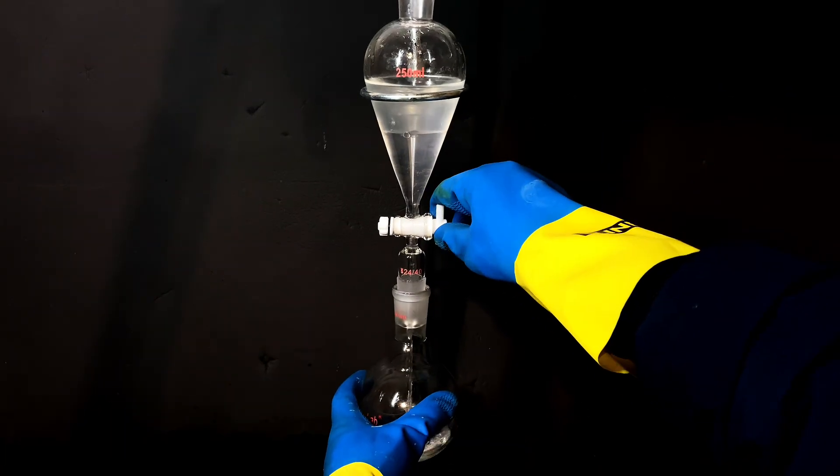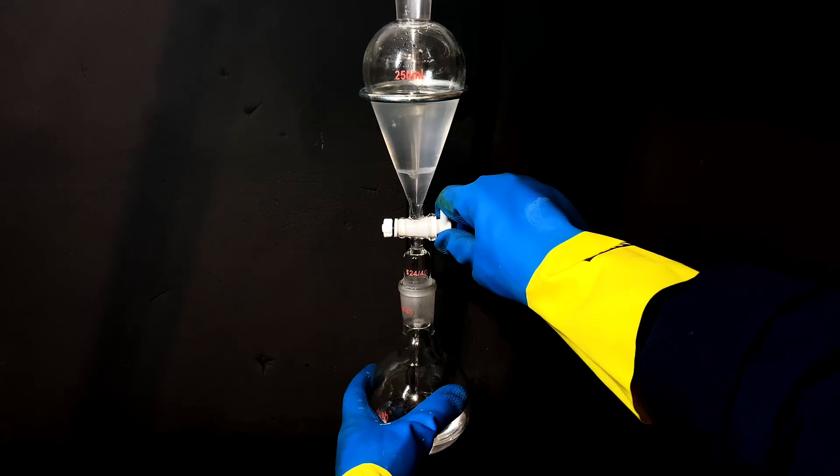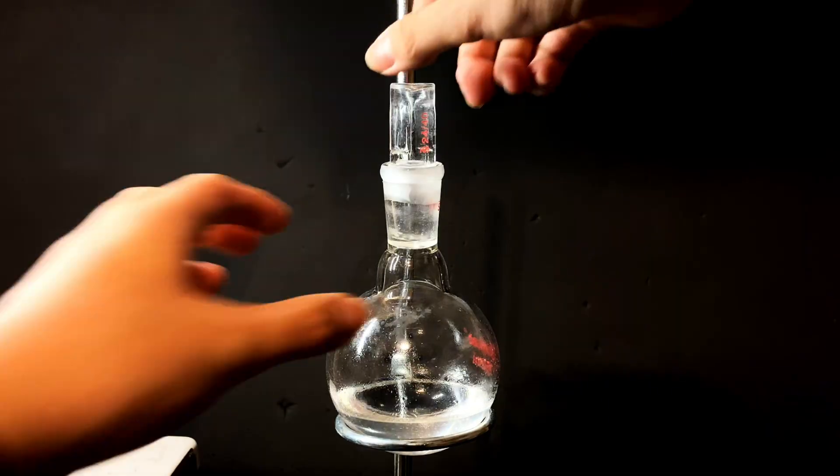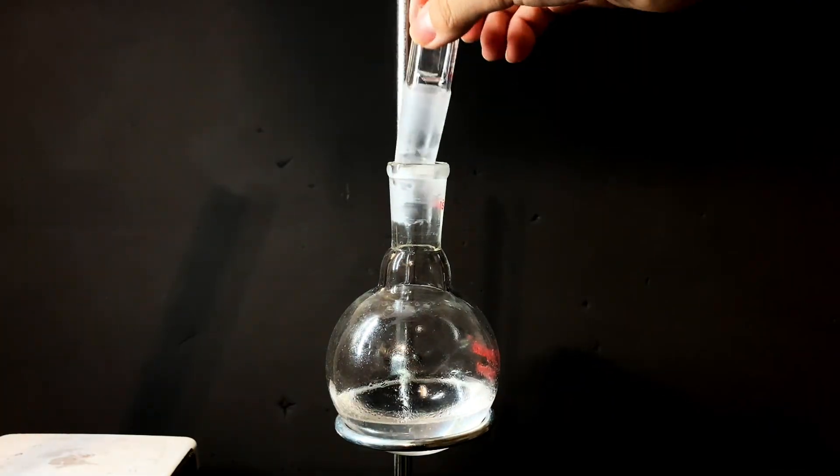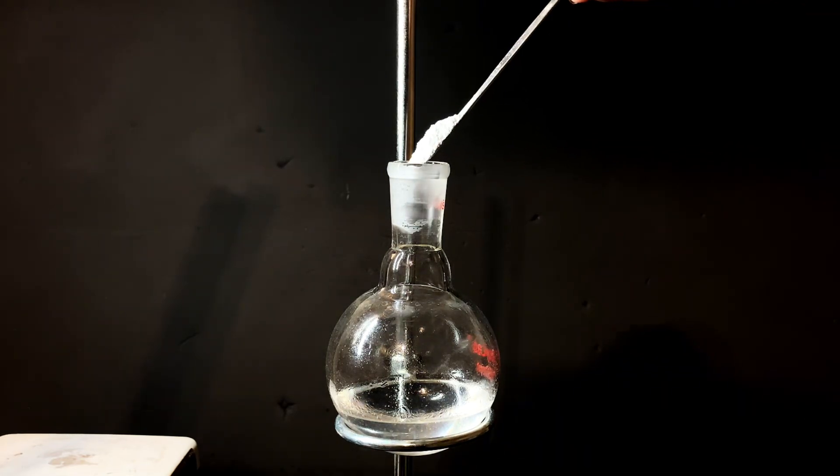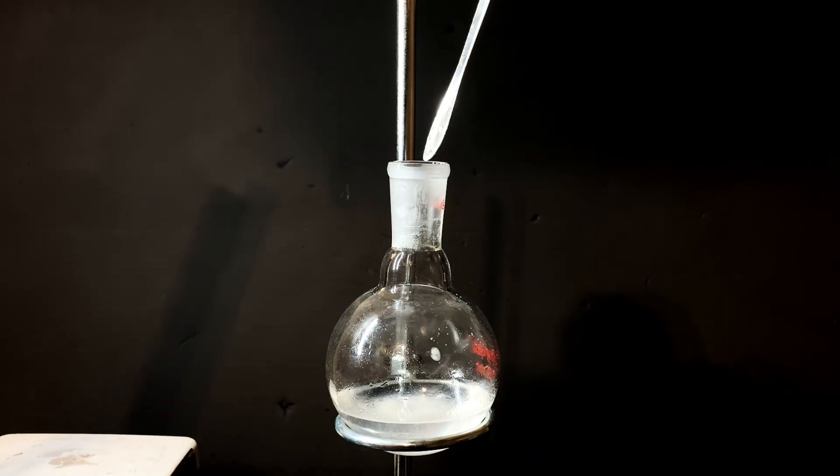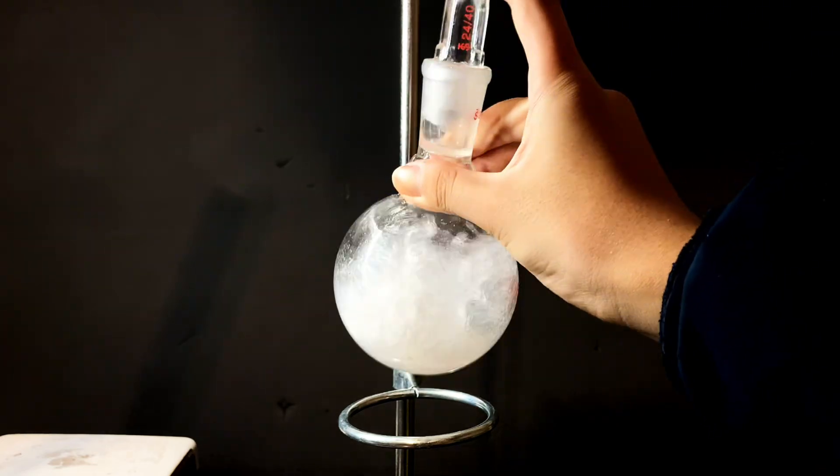I could then empty the clean chloroform into a round bottom flask, and add in some anhydrous magnesium sulfate to dry the chloroform as well. As you can see, the cloudy color basically goes away and it gets a lot clearer after its addition and swirling around a bit.